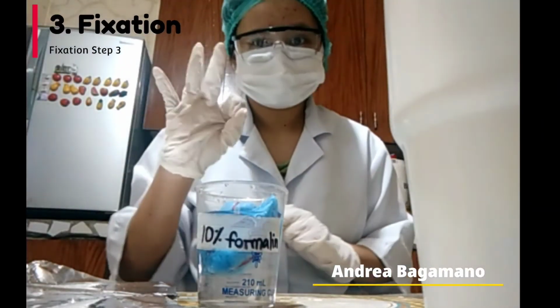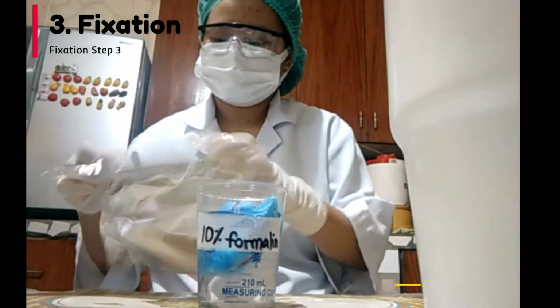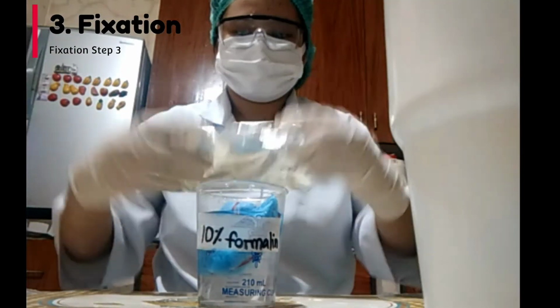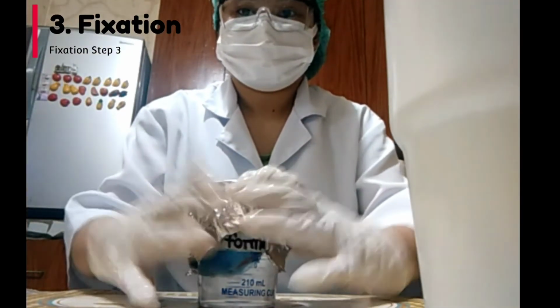Hi, I will be doing step 3 of fixation. After putting the tissue cassettes in a beaker filled with 10% formalin, we will now cover it using foil and leave it for 18 to 24 hours.